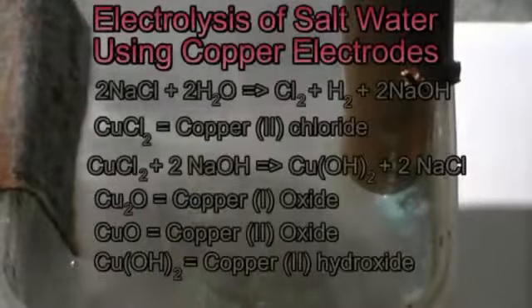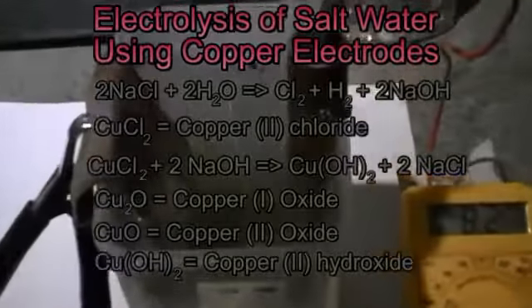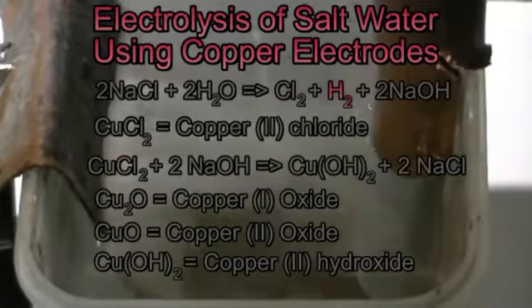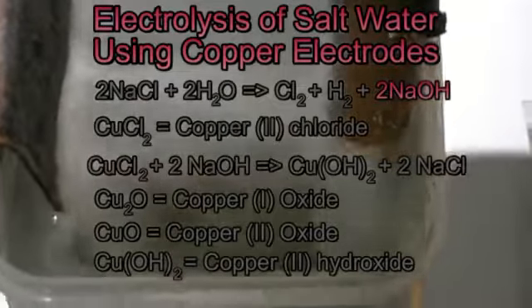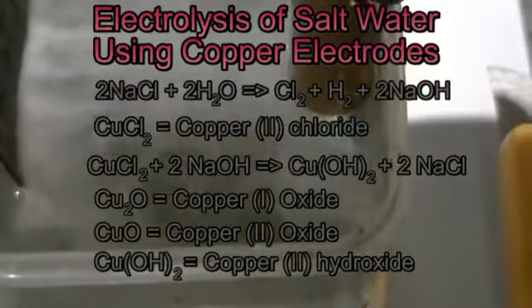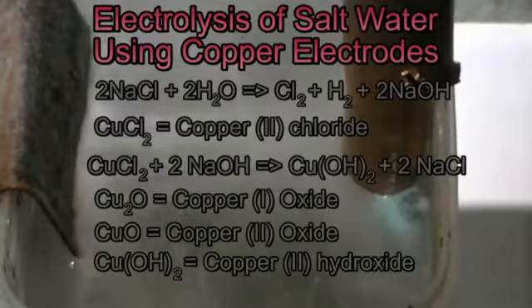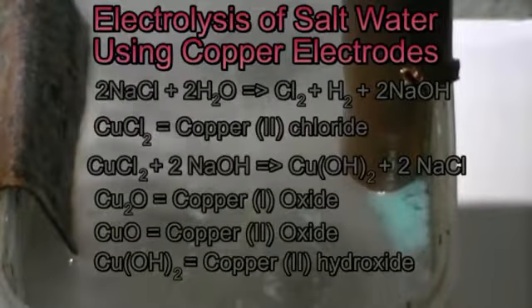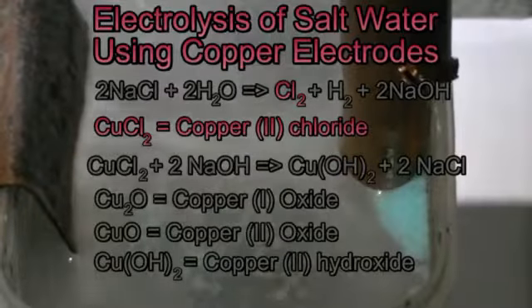A number of chemical reactions might be taking place in this electrolysis setup. Firstly, electrolysis of sodium chloride solution tends to produce chlorine gas at the anode and hydrogen gas at the cathode. Sodium hydroxide is also produced, however this remains in solution. As we are using copper as our electrodes for both our cathode and anode, this may react with the gases being produced. Copper metal tends not to react with hydrogen, however copper can react with chlorine to form copper chloride.